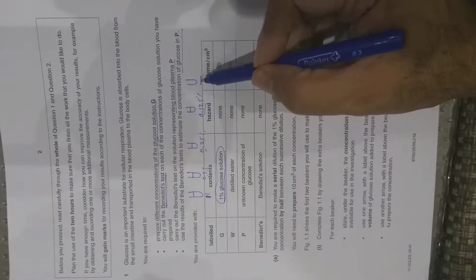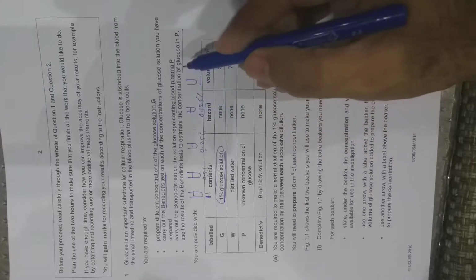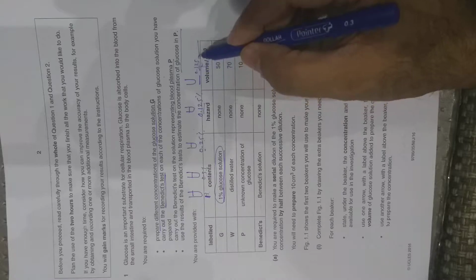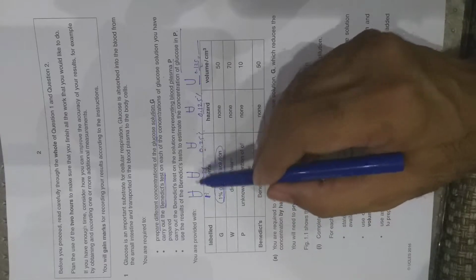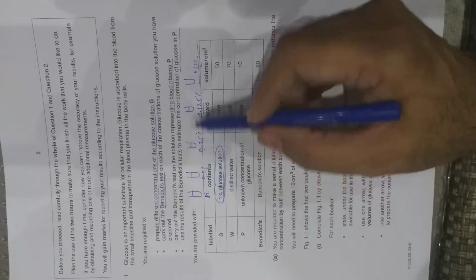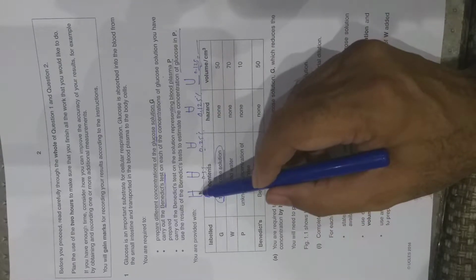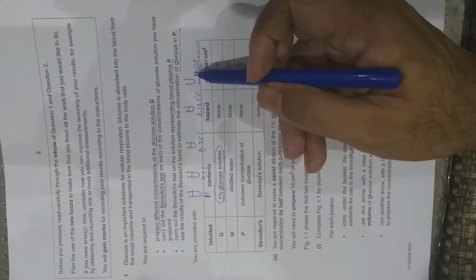and whatever the value you get by dividing 0.125 by 2. Whatever value you get, this would be the last percentage here. So you have to prepare these concentrations and carry out the food test with each of them. When you carry out the Benedict test, these may change color, and you have to record the time taken for the first appearance of green in each case.